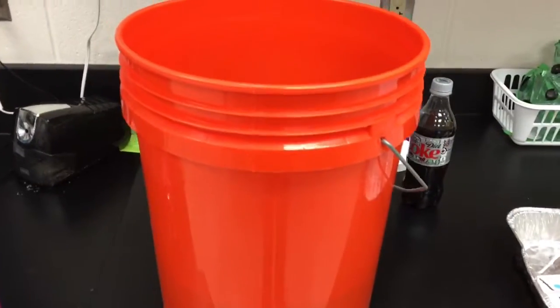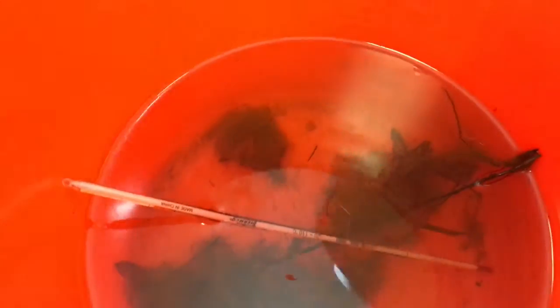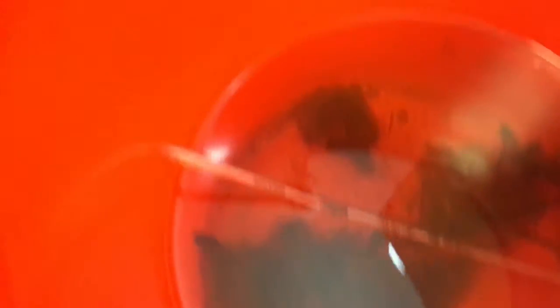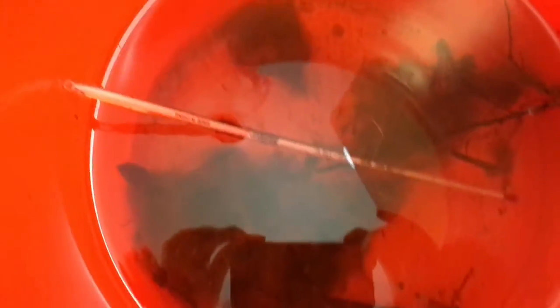Here in this orange bucket I have a sample of the pond water, and as you can see there is a large variety of algae, there is some sediment in there, and a thermometer because we're going to be taking the temperature in just a moment.